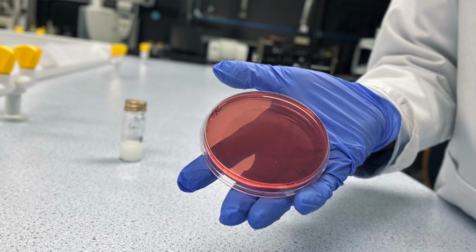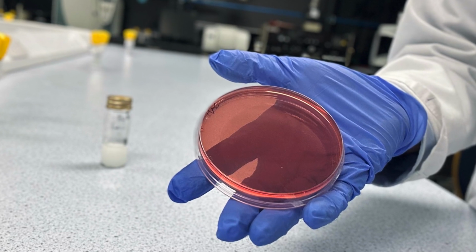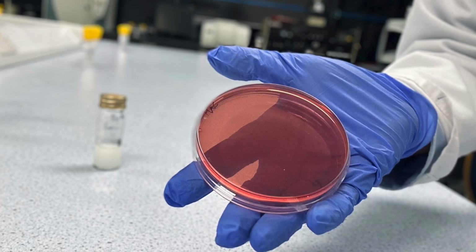And additionally, some MacConkey agar plates which will selectively isolate gram-negative organisms and contain neutral red as their indicator, giving rise to pink colonies when the microorganisms in question are fermenting lactose.